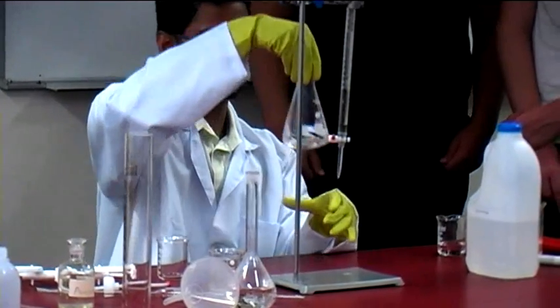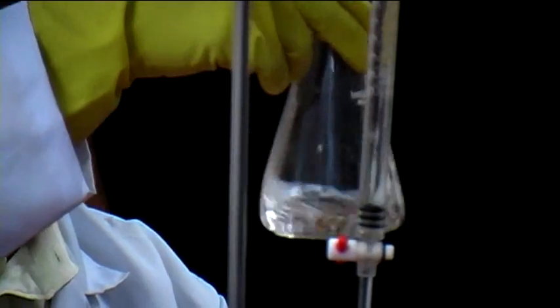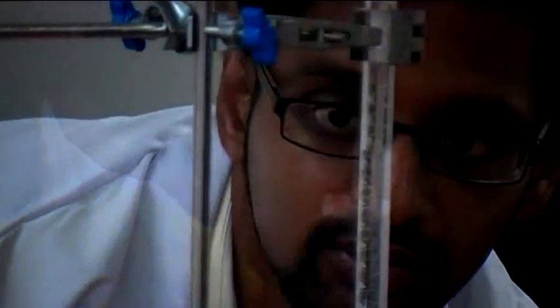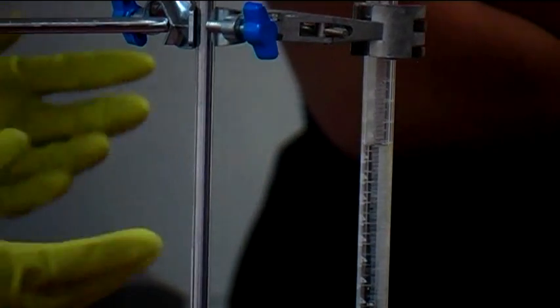There's two drops, and two drops, and we've suddenly got to below 8.3. We are close. 40.3. So 23.9 up to 40.3. How many mL was it?